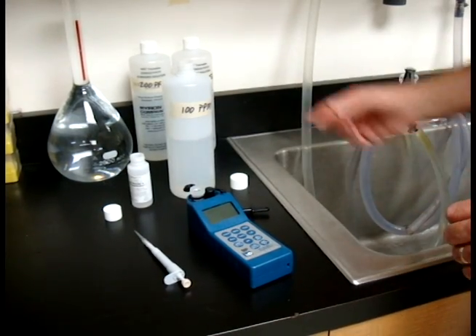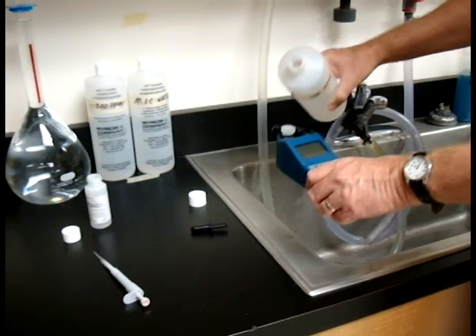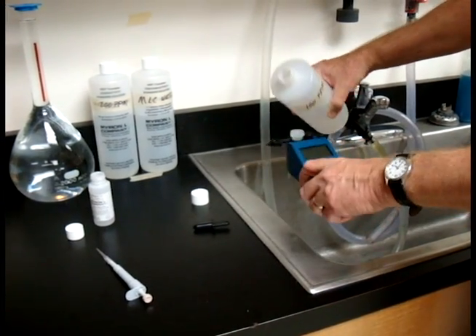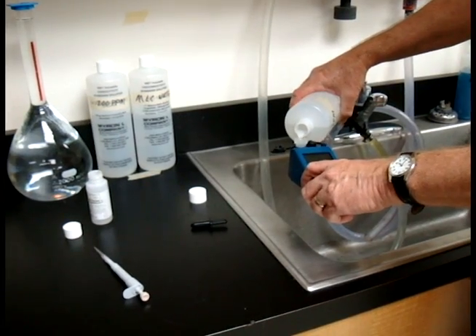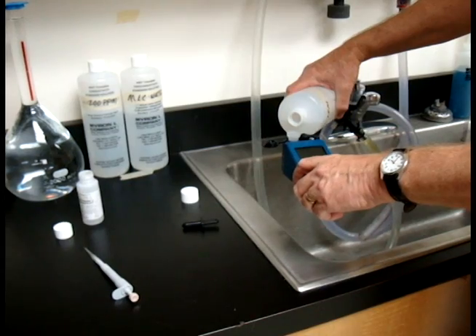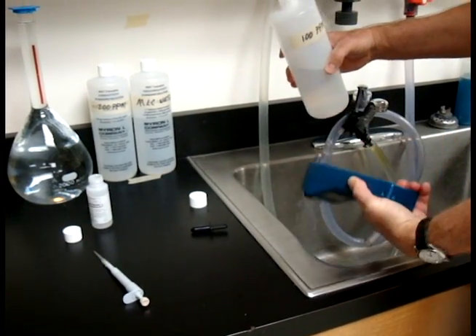Now you're pretty much ready. We're going to start with three rinses of the solution to be checked. I always like to try to get the cap too. One, two, and this is three, and then we fill it up.